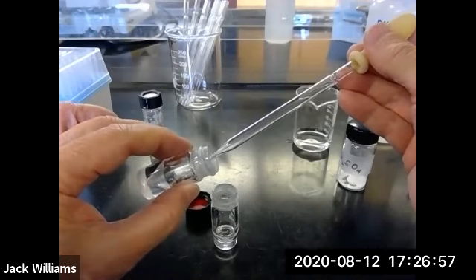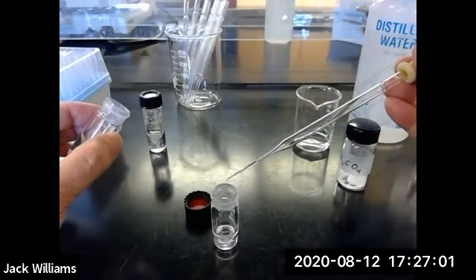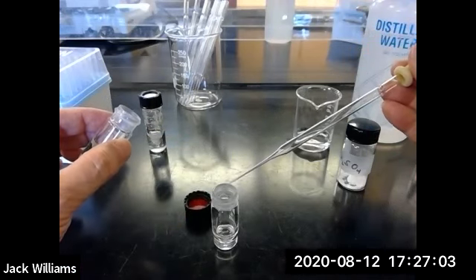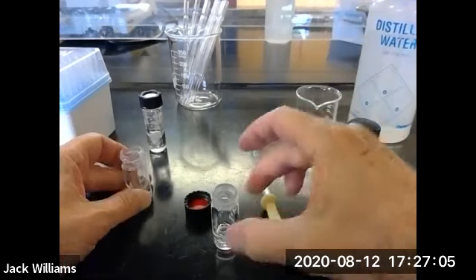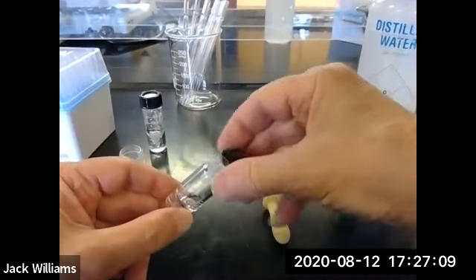See if we can get the last few drops. Okay, down on the bench top. And now I want to cap this.